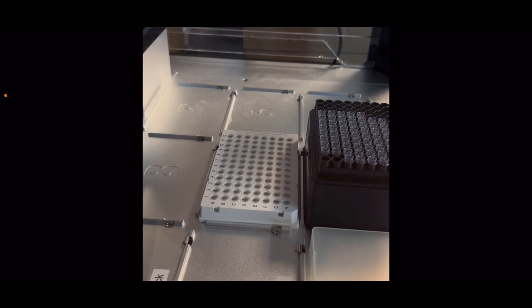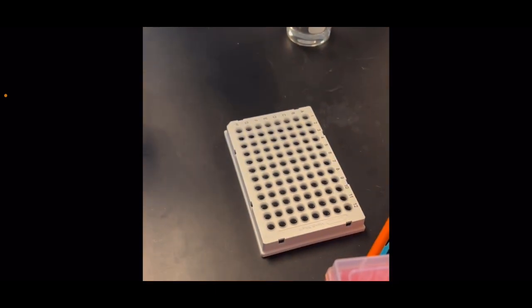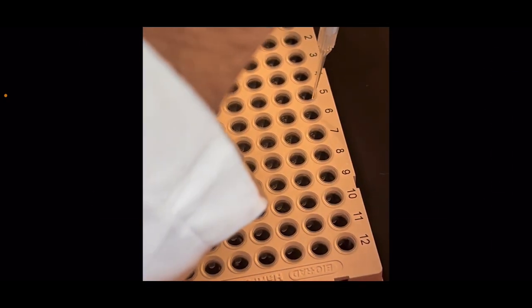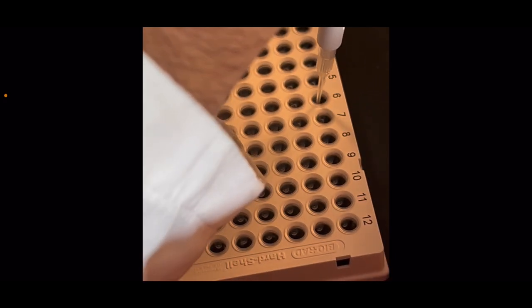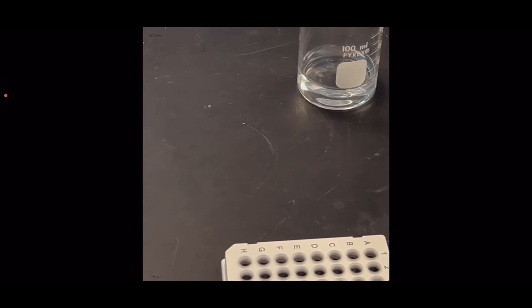So now that means A1 through A5 has a BSA dilution of 1 to 10, and B1 through B5 has a BSA dilution of 1 to 2. Now I am manually adding 1 microliter to A6, so I can use it as a comparison for what the correct dilution would be, or the dilution of a human, to prove that the Opentrons is at least as good as a human. Now I'm adding 5 microliters of BSA stock solution to column B6.